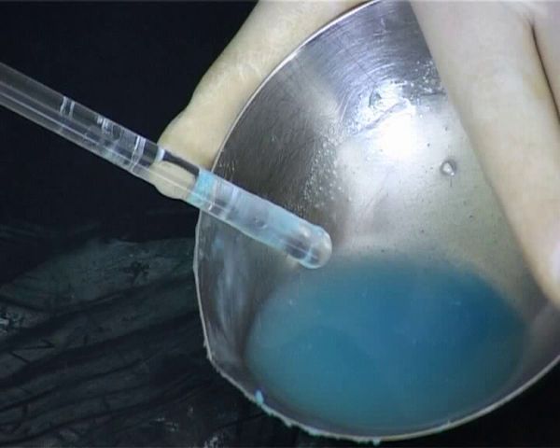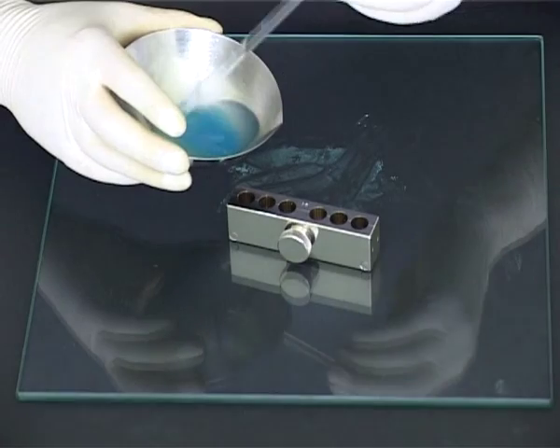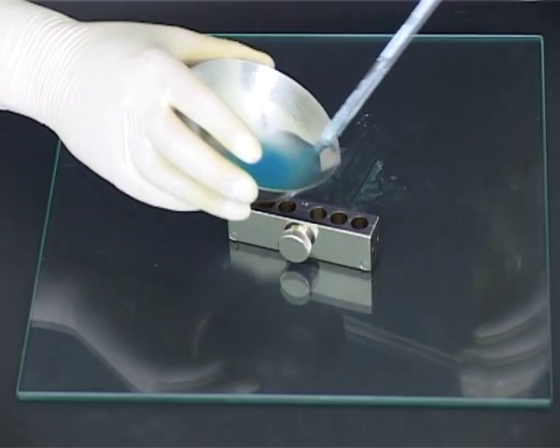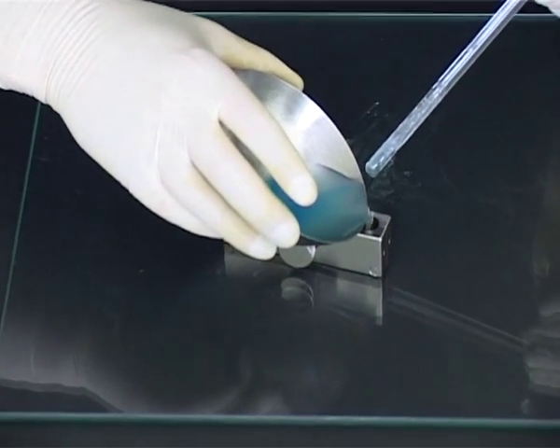Once the solid is remelted continue stirring until the base is just about to solidify. This is easy to judge with experience but as a guide look for a slight sheen on the surface of the molten mass, rather similar to a skin forming on hot milk. In one movement pour the mass into the mould, allow it to overfill slightly.